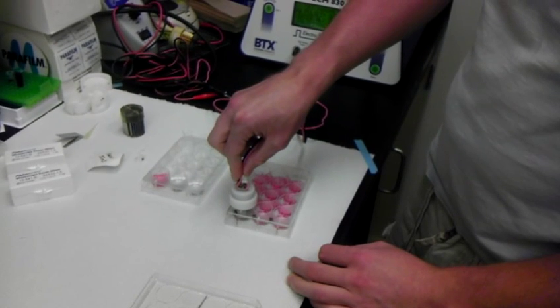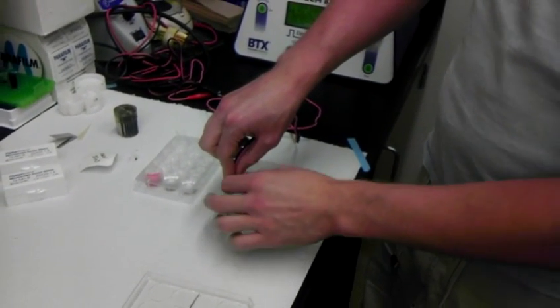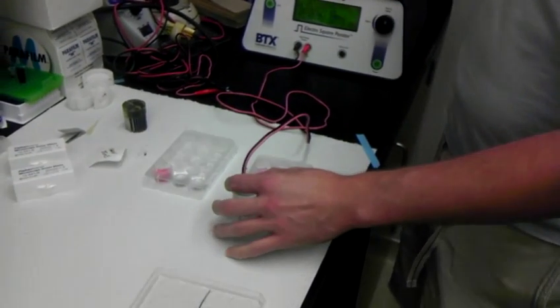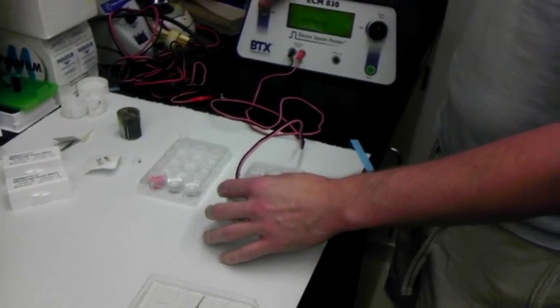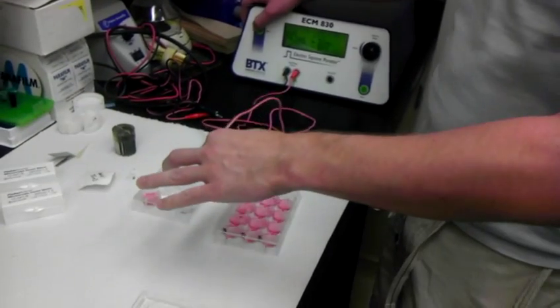So that's too far. No, it's not. It's not too far. Cool. Okay. So put it in there, and then you just hit the start button. And then it will shock them. Pull out. You'll see a bunch of bubbles.